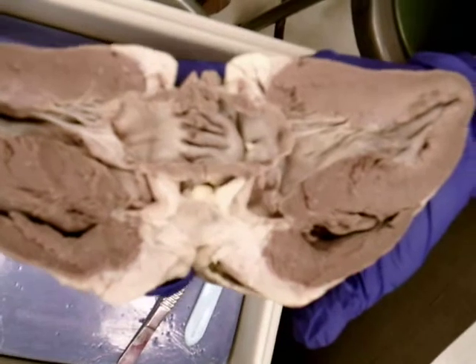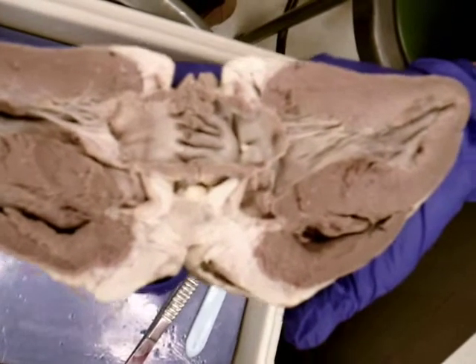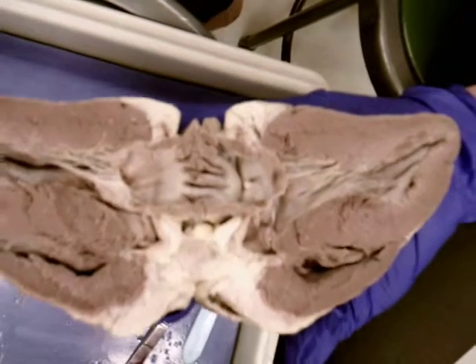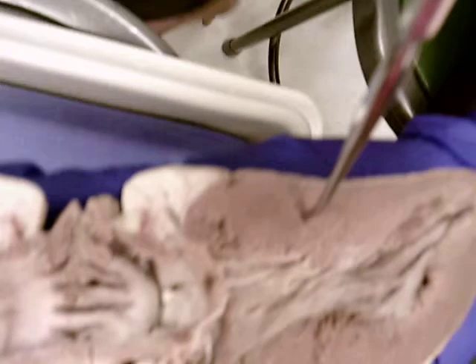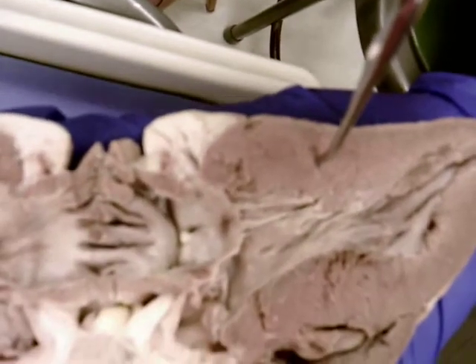Now on your lab exam 3, do not be myopic. Don't be so focused on the pin. Remember, the questions are important. If, for example, you see a pin right here, and it says, what layer of the heart is this? What would you say? Myocardium.